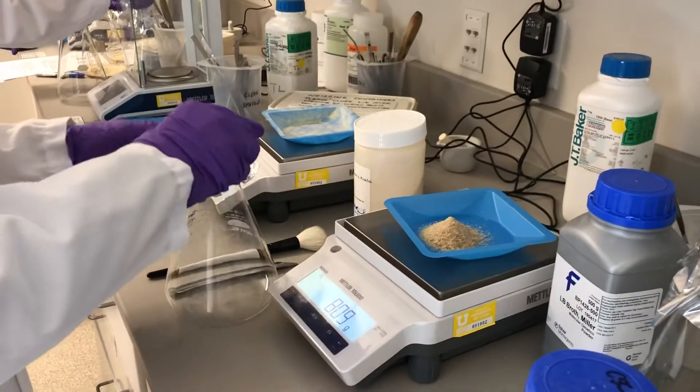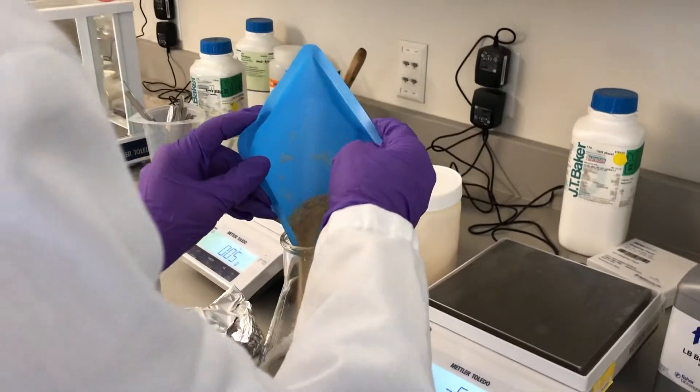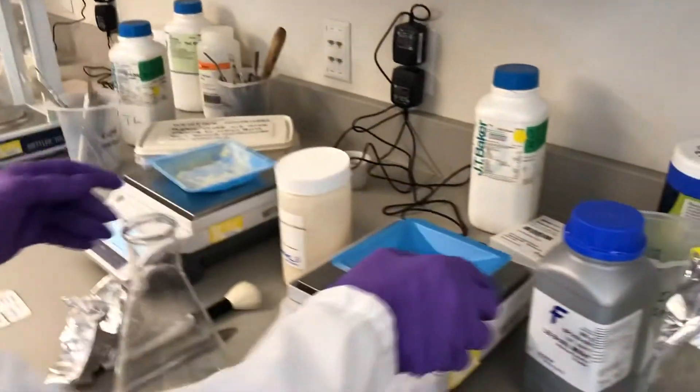I'm not going to put any of this back. Take my dry flask and tip the ingredients directly into the flask.